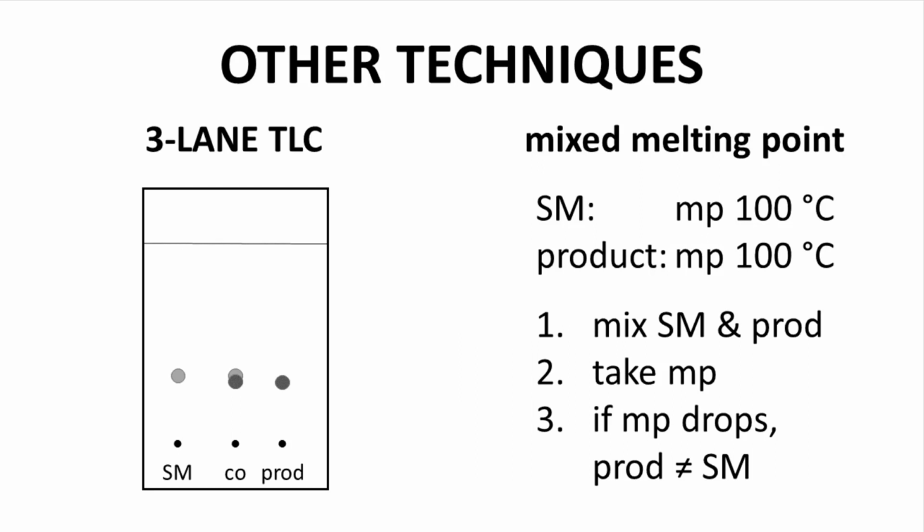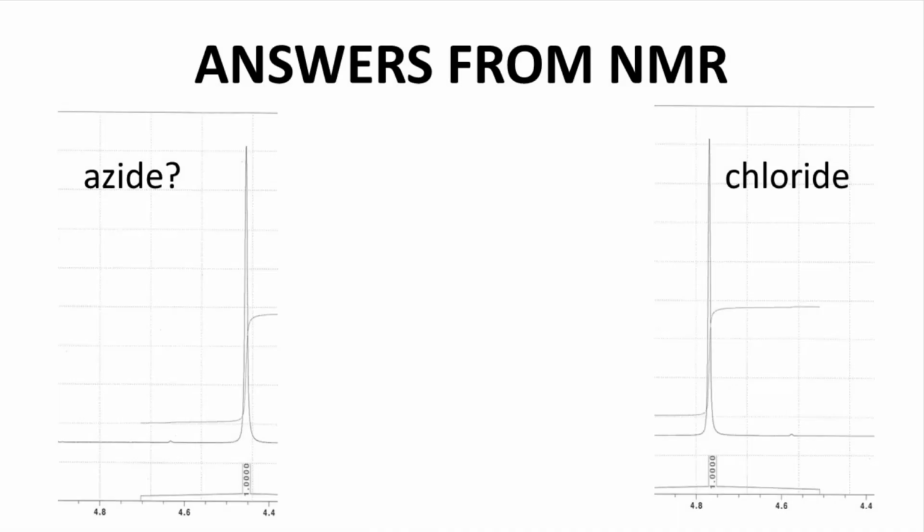In both the TLC and melting point examples, the identity of a compound is confirmed through direct experimental comparison to the properties of a known compound, the known starting material. We can use this same idea with NMR to solve our mystery with benzyl azide. Back to NMR spectra. On the left is a zoomed-in spectrum of the CH2 singlet of the product, which I believe is the azide, but it would be nice to be more certain. The CH2 singlet is very close to 4.45 ppm. To the right is the spectrum of benzyl chloride, the starting material.